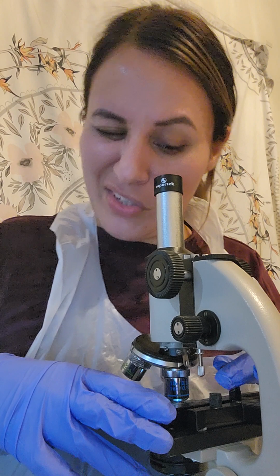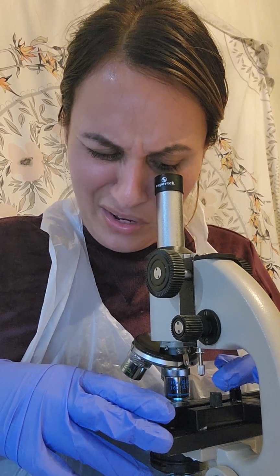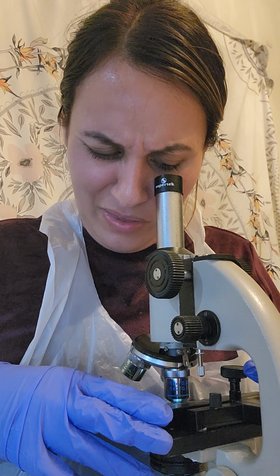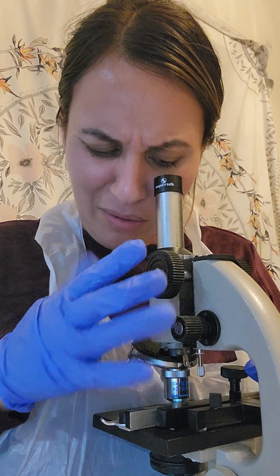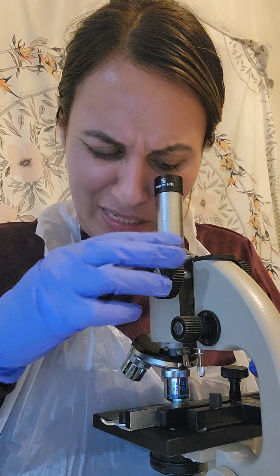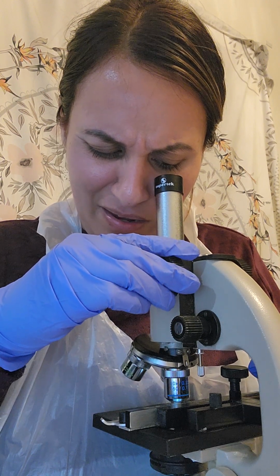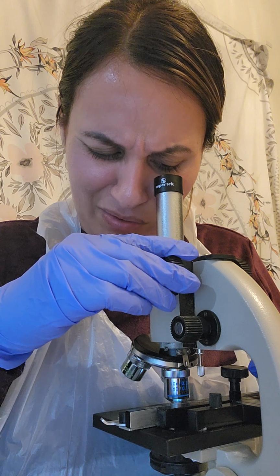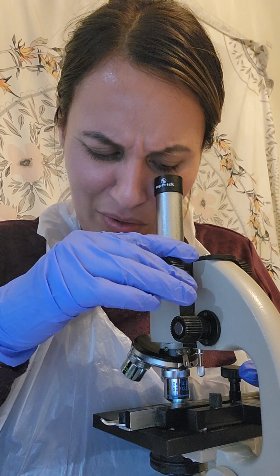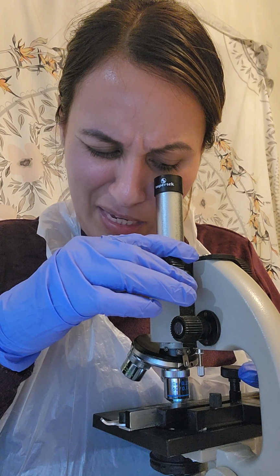I think one of my challenges is getting the pictures. So for this one, I think that once you have the focus knobs already kind of set to where you need them, it's pretty easy to see stuff, especially if you're doing the same type of observations.